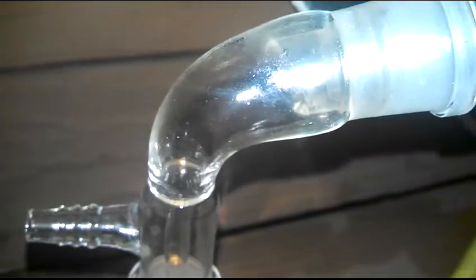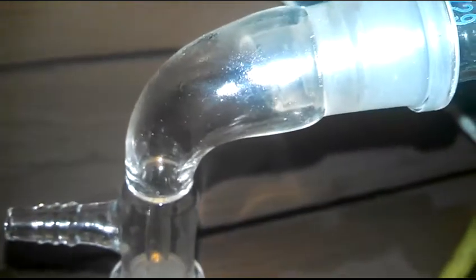I just need it for dissolving gold, platinum, and palladium and stuff. It's fine by me if it's fuming yellow nitric acid. It's gonna get diluted anyways. I'm trying to get it down to the 68% azeotrope and then I'll distill it again, fractionally distill it.